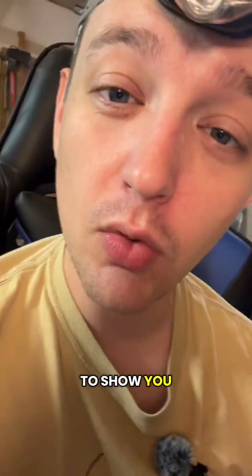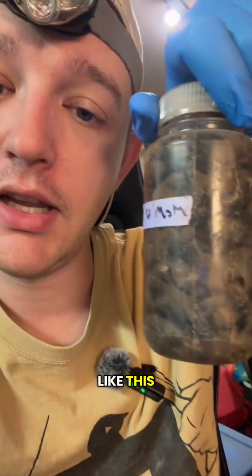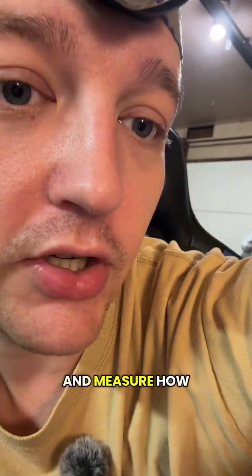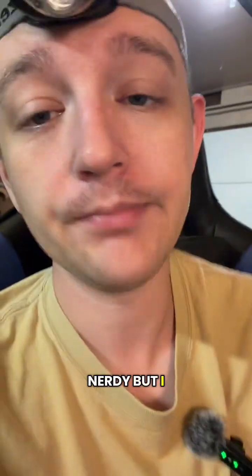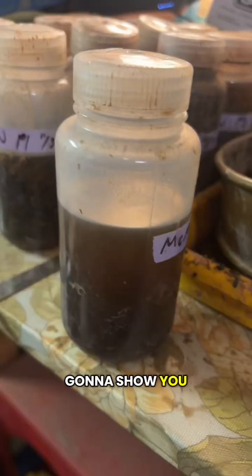Today I wanted to show you all how I take a bottle of zebra mussels like this and measure how big they all are using computer software. So kind of nerdy, but I had some people ask, so I'm going to show you.